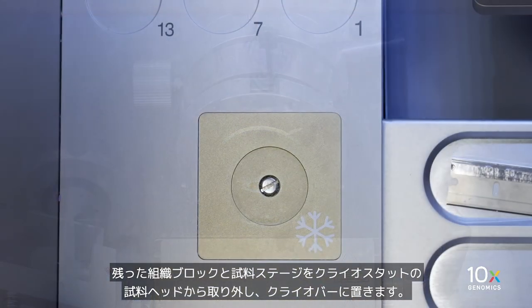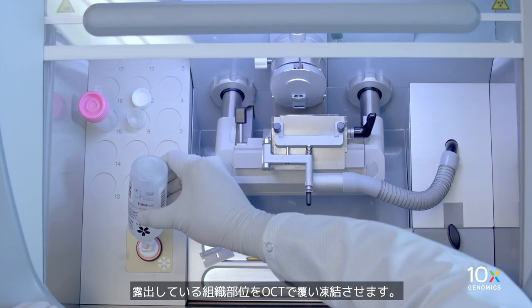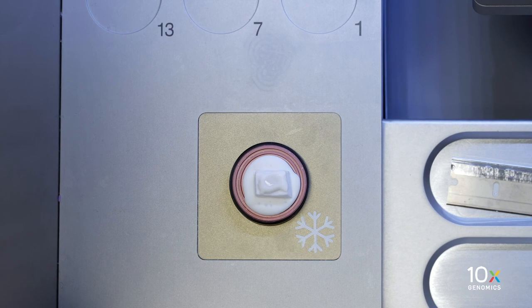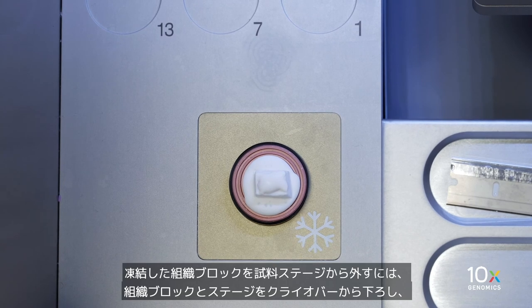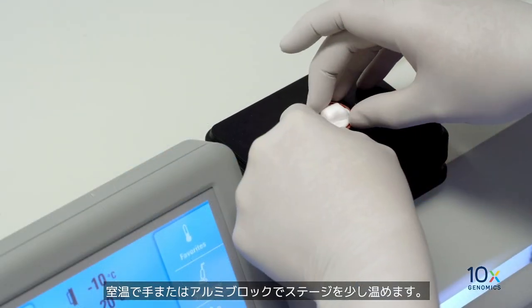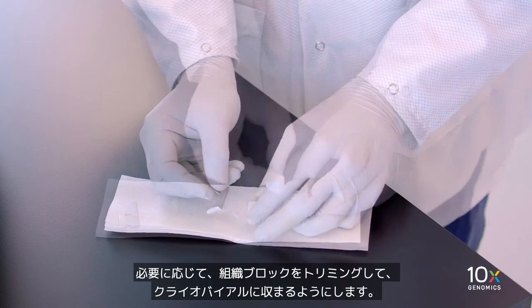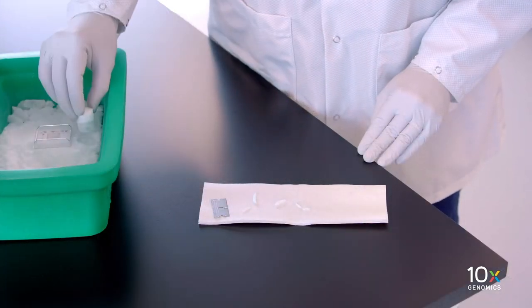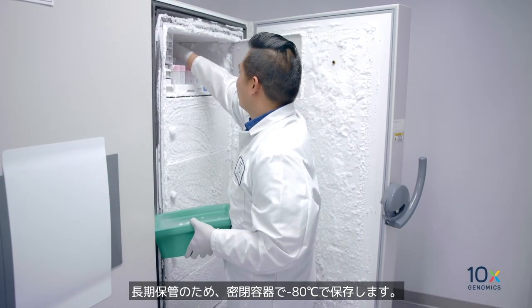Remove the leftover tissue block and specimen stage from the cryostat specimen head and place on the cryobar. Cover the exposed tissue with OCT and allow to freeze. To separate the frozen tissue block from the stage, lift the tissue block and stage from the cryobar and lightly warm the stage with your hands or an aluminum block at room temperature. If necessary, trim the tissue block to fit into a cryo vial and store in a sealed container at minus 80 degrees Celsius for long-term storage.